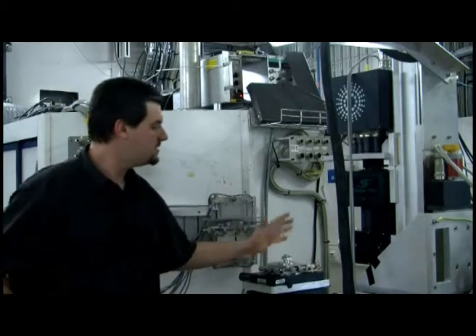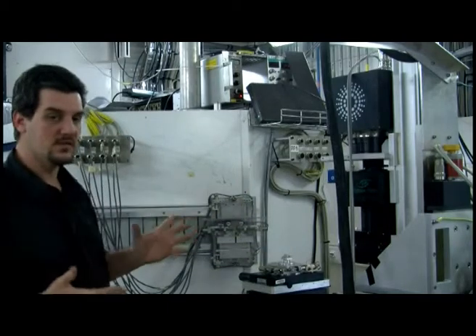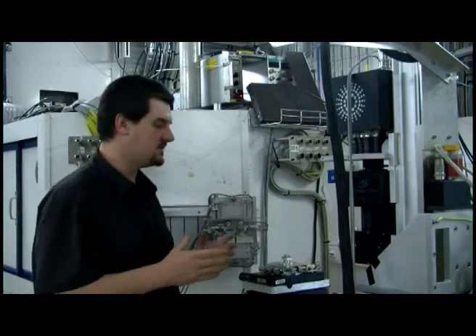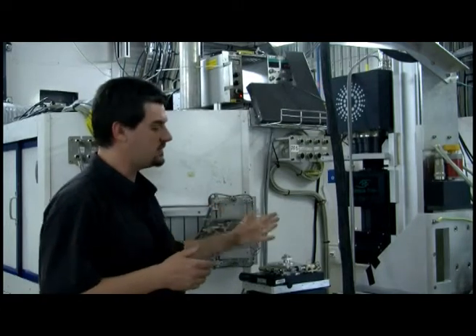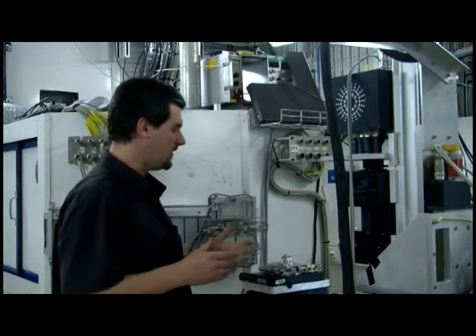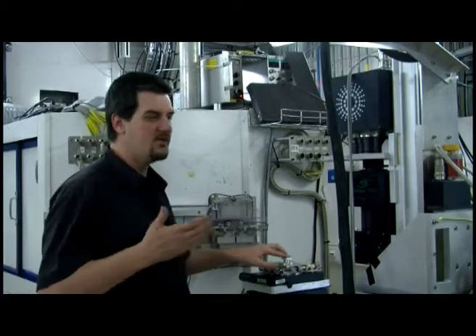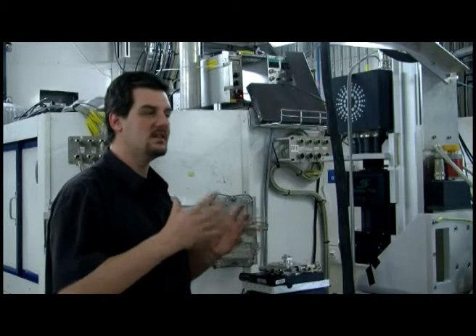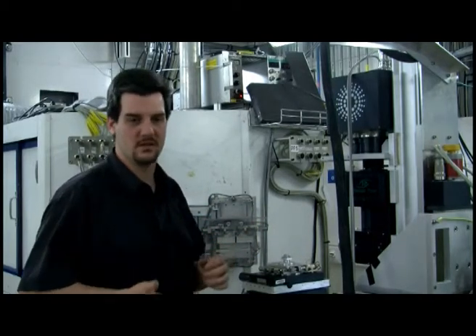And so why are we using such kind of device to scan fossils? It's because here you are in a synchrotron, in a third generation synchrotron. And so first you have very powerful X-rays, but also you have X-rays with very specific characteristics on the physics aspect. And one of these very important things is what we call the coherence. I will not give explanation of what is coherence, but to give you an idea, it's a way to see details in a sample with a sensitivity that is about 1,000 times better than with any conventional source.